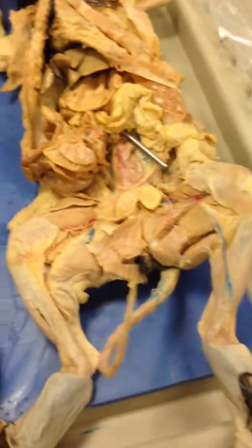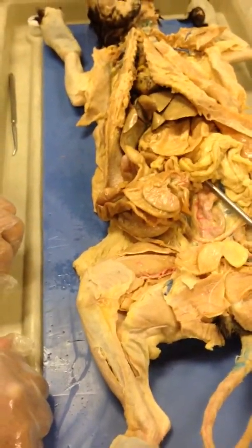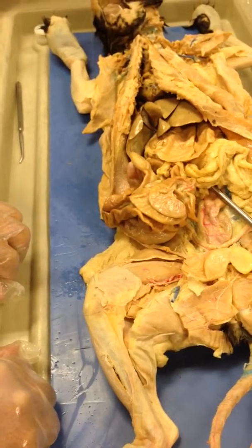You showed us the esophagus. We know where the diaphragm is, and the esophageal hiatus. And the pancreas. The pancreas.